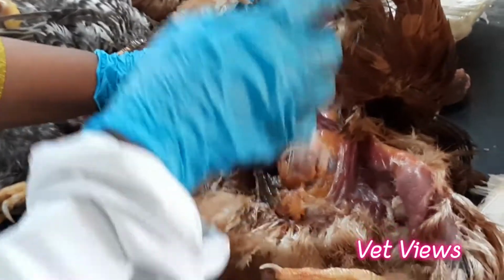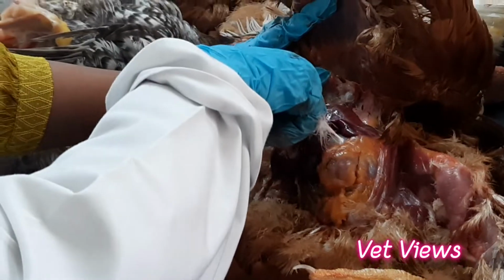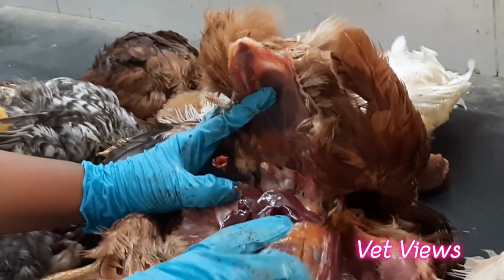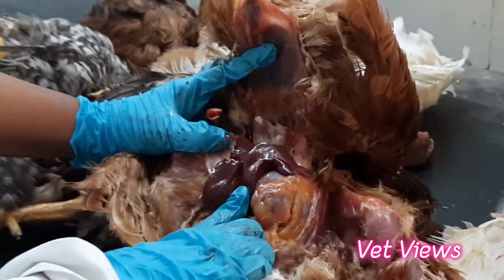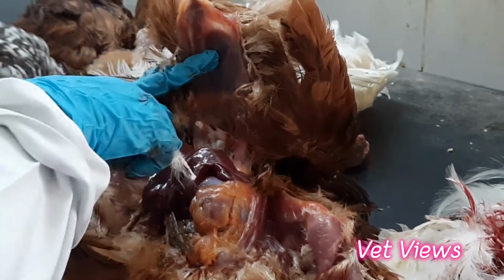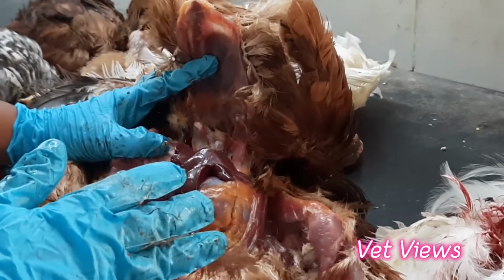What happens in CCRD? A white membrane kind of thing. This one and that one you have to be able to differentiate. Here it looks like chalk. When you sprinkle chalk over the heart, it looks like this. There will be a uniform membrane deposited over the liver. That is called perihepatitis. And over the heart also, that is called pericarditis. Here this case is gout. Both conditions look a little similar in the initial stages. Once you start observing, then you can differentiate.